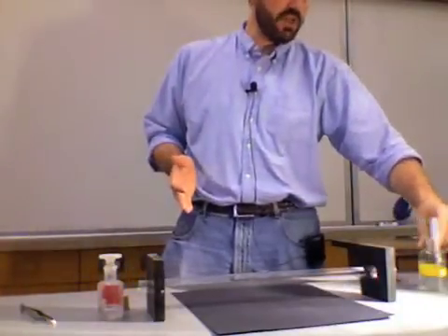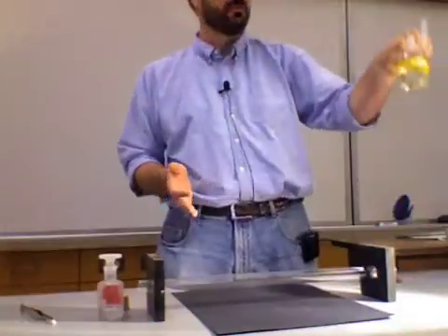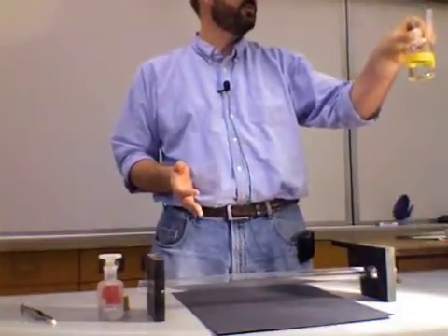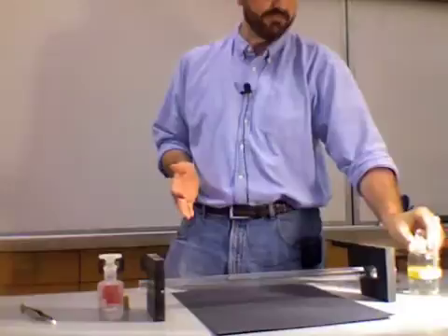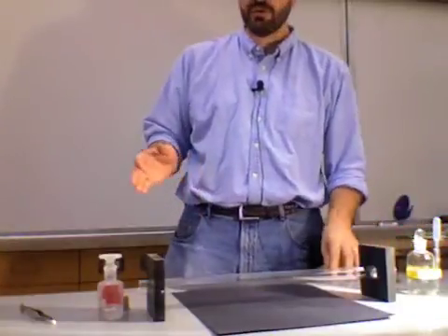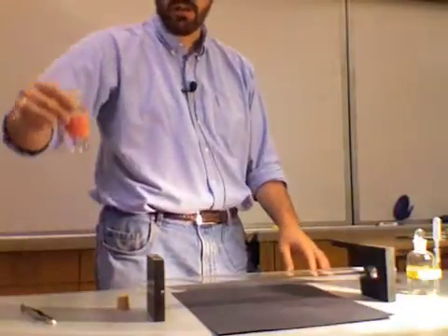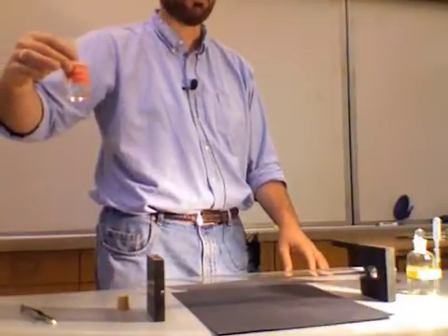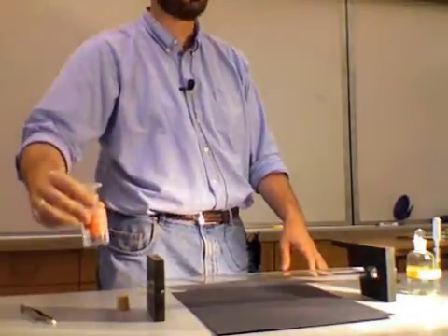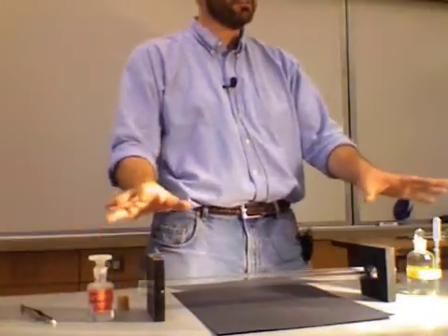One gas is going to be ammonia, which is going to be provided by this concentrated ammonia solution. It's 15 molar ammonia, pretty close to pure ammonia. And the other one is hydrochloric acid. I have this bottle of concentrated hydrochloric acid. It's about 12 molar hydrochloric acid. So these are both highly concentrated solutions.